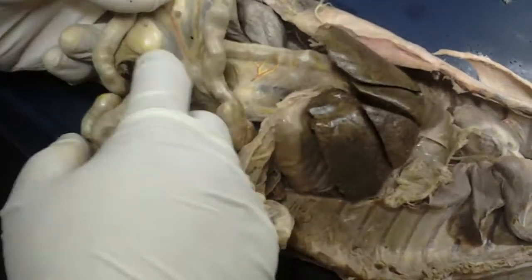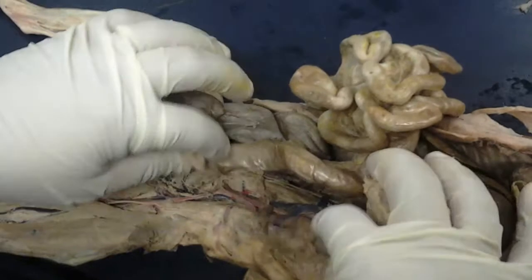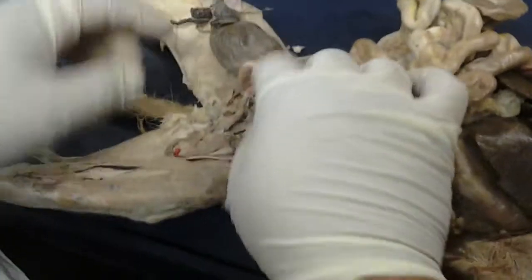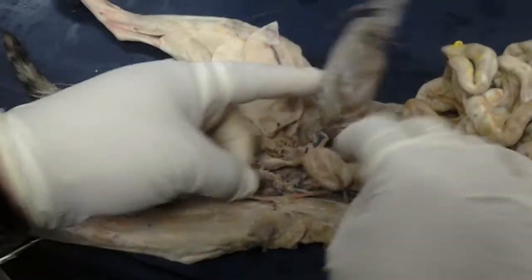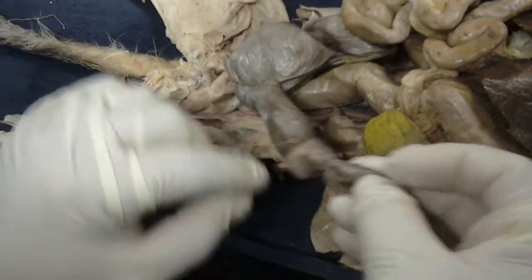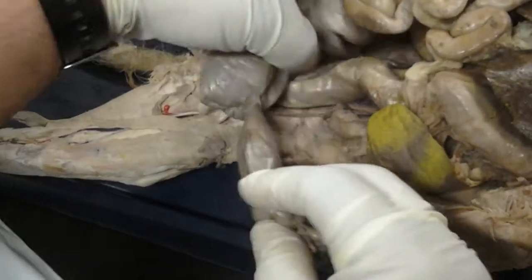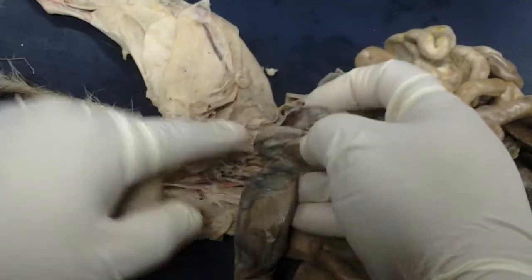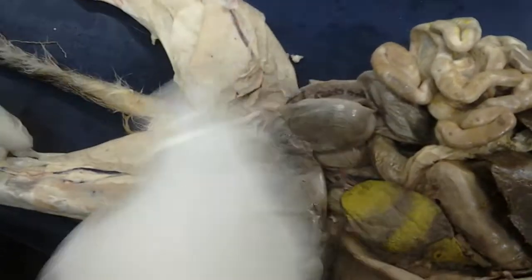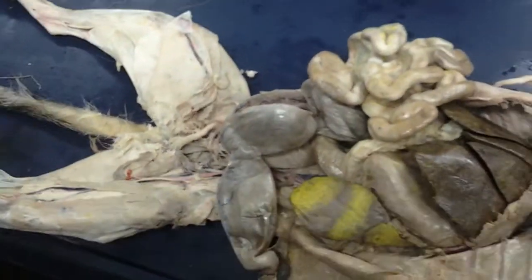Aside from that, you see the mesentery, the greater omentum. Here is the spleen. Obviously, you have your kidney here with the ureter attached. Urinary bladder, urethra, the ovary right there, leading to the horns of the uterus. Where these two combine, it's the uterus, and as you continue caudally from here, that leads into the vagina and out. And I think that's it. I think that's it, right?